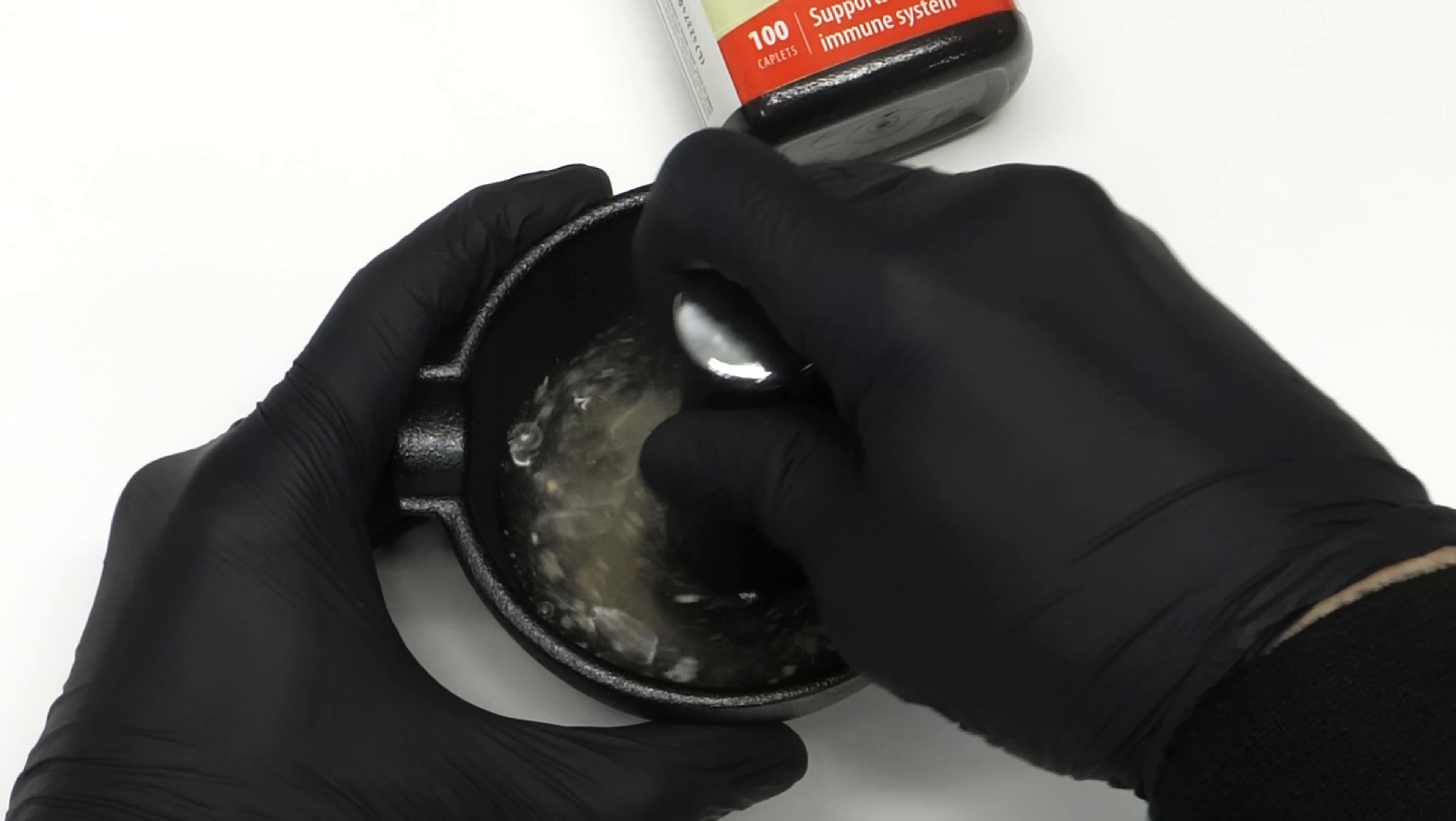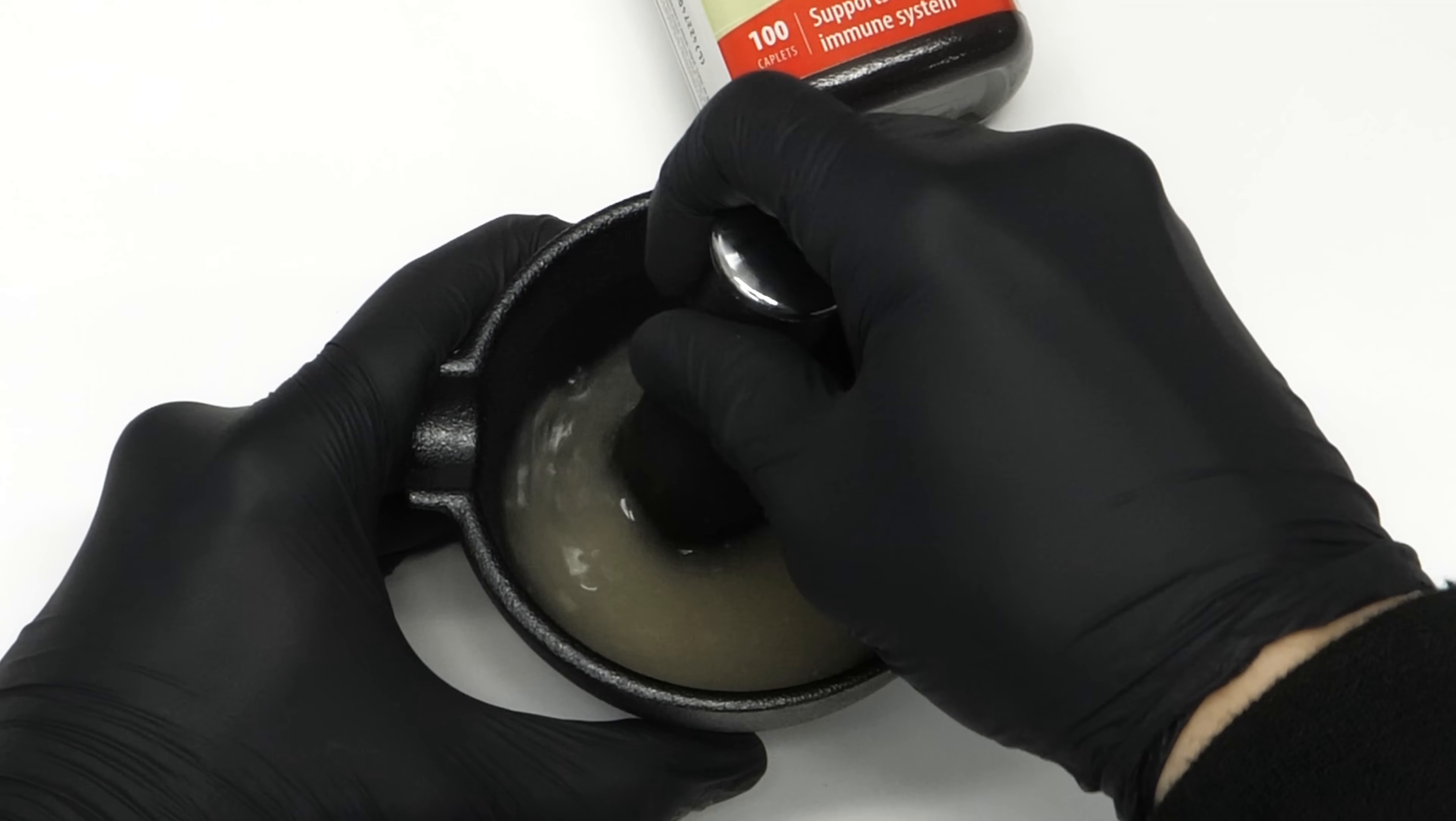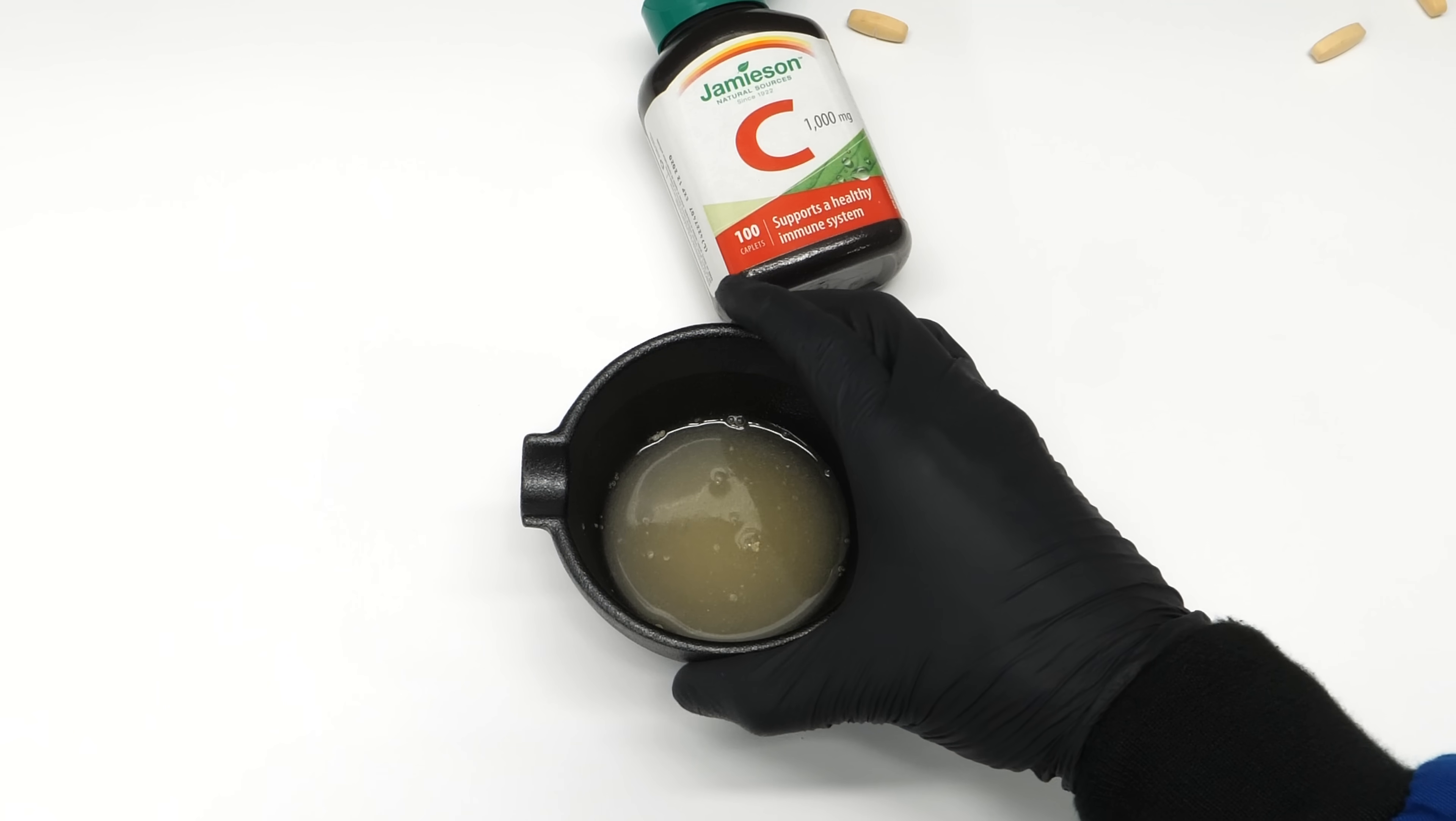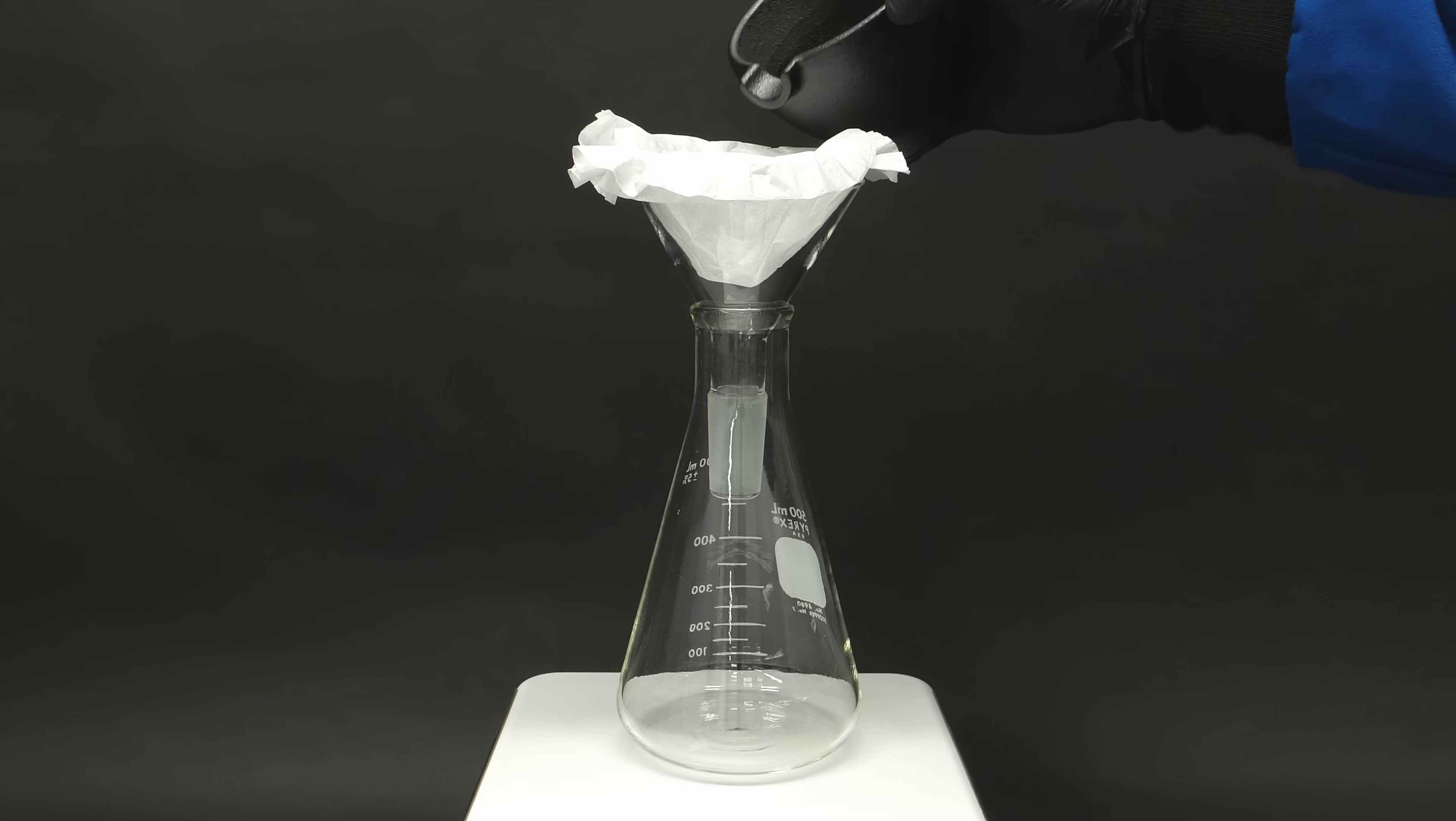What I'm doing here is pulling out the vitamin C from the pill and leaving behind a bunch of filler. Like before, I'll dump this into some coffee filters to clean it up.